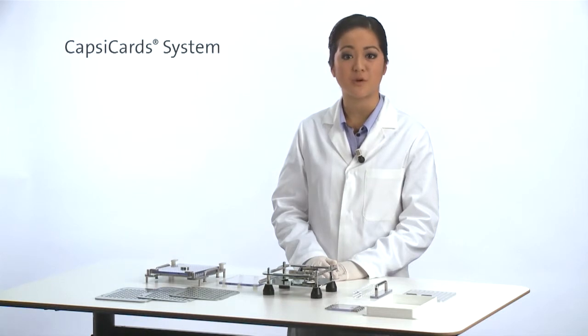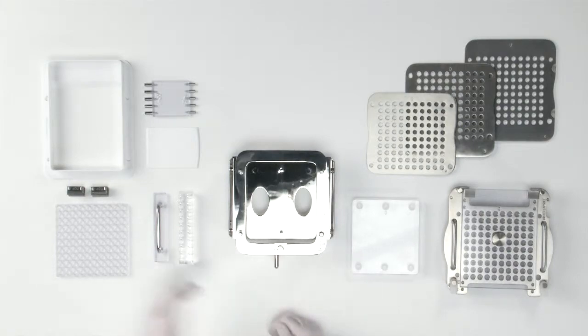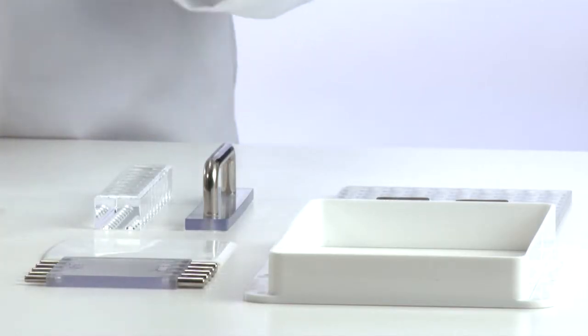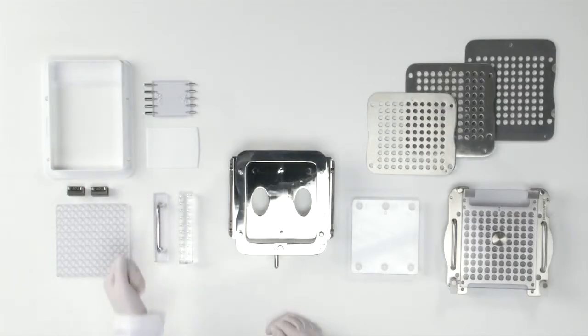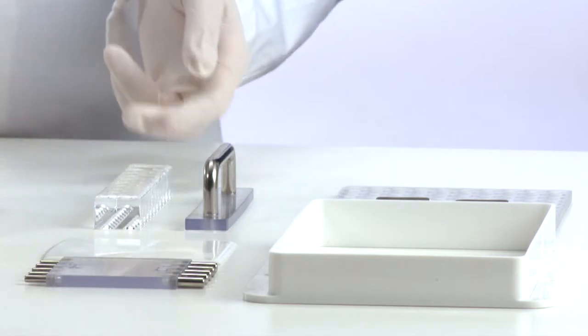The filler base kit will come in a box and contains the following 8 items: the filler base, the powder tray, two powder tray clamps, the adapter, the 5 pin tamper, the powder spreader, the pusher and the capsule locker.